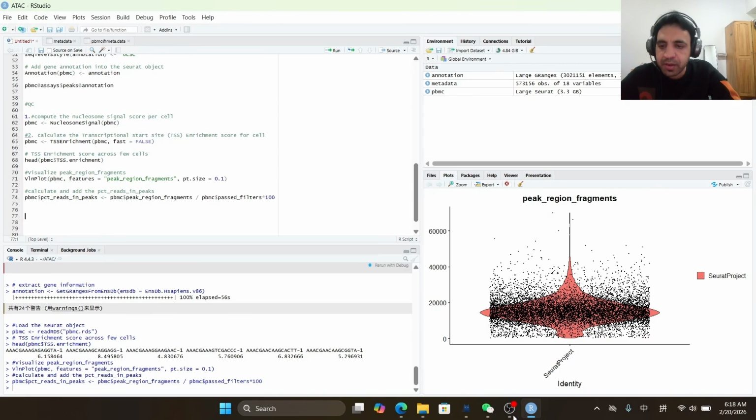Now we will add a blacklist ratio to the Seurat object, which is a new metric. A blacklist ratio is a ratio between the blacklist region fragments and the peak region fragments. So it is a ratio of blacklist region fragments and peak region fragments.